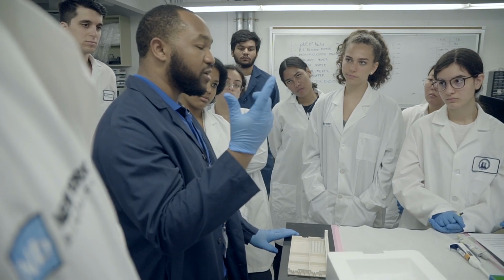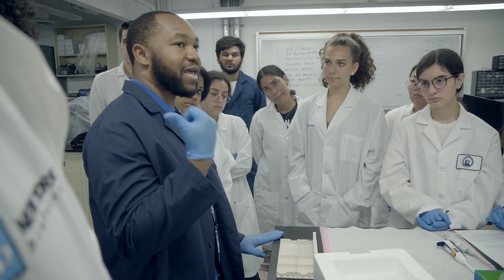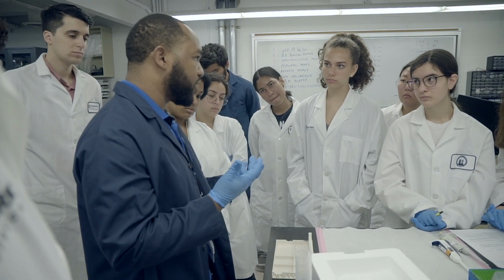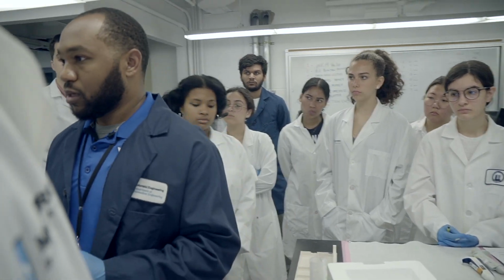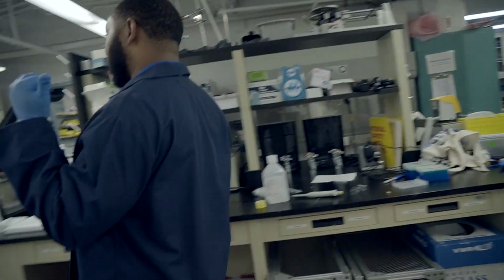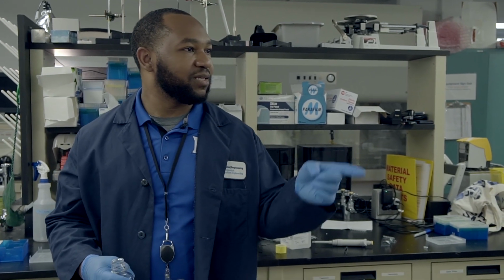Once it heats and makes a gel, you'll see it's kind of thicker. We'll pour it in. Before we pour, we're going to add the SYBR Safe, and then we'll pour it in, and then we'll wait till after lunch. We'll be good. Make sense? What's the SYBR Safe do? So that's after we heat it. What does SYBR Safe do? Why do we add that?